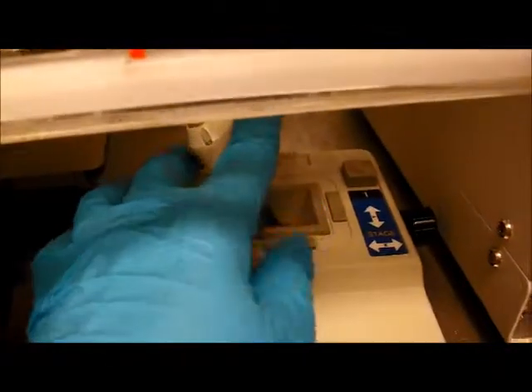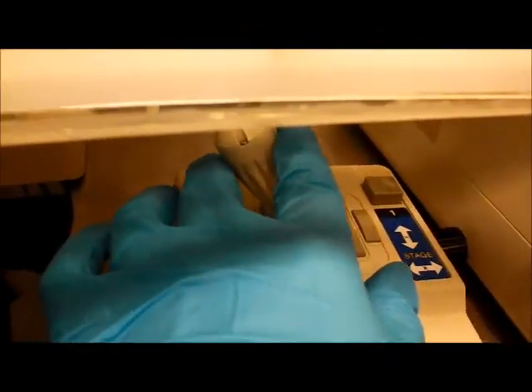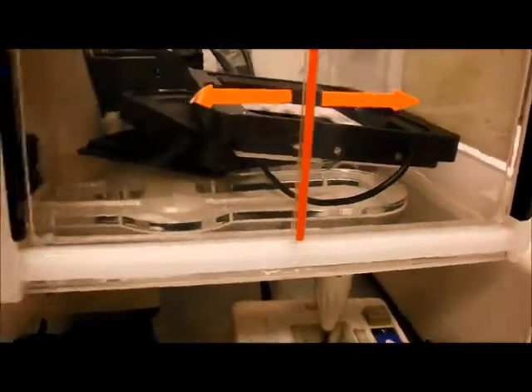So I can focus on the side here. If I get the cells in focus, that would be where the scratch is, say. Or I can translate using the joystick here. So this particular wound is all healed up. Don't press the button on top of the joystick because it upsets the calibration. Just move around. I'm going to pretend I found a scratch here. That looks good. It's in the right position.